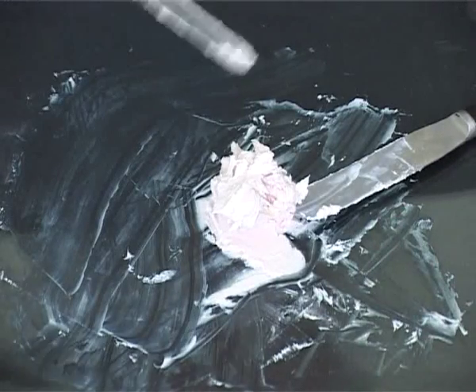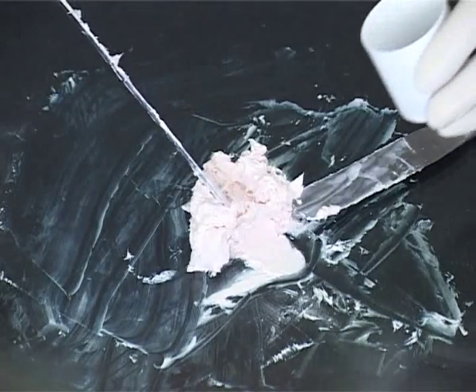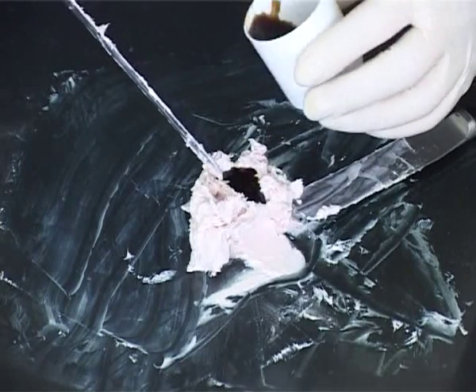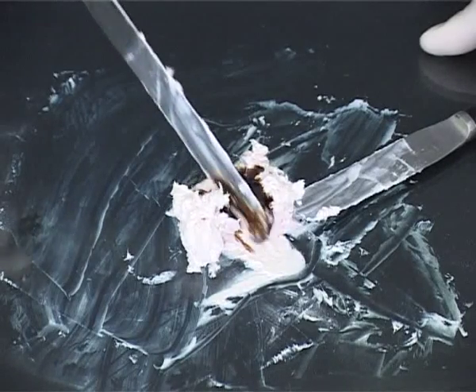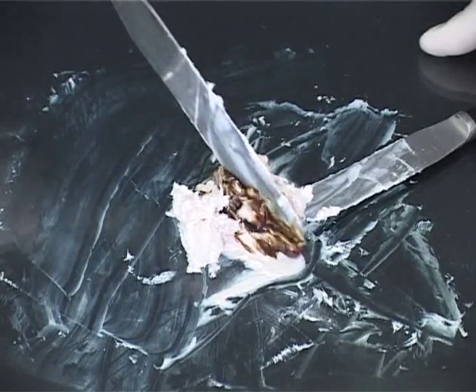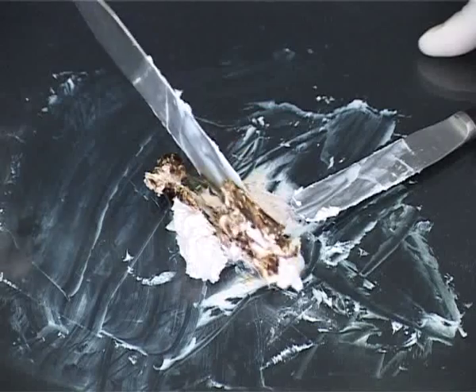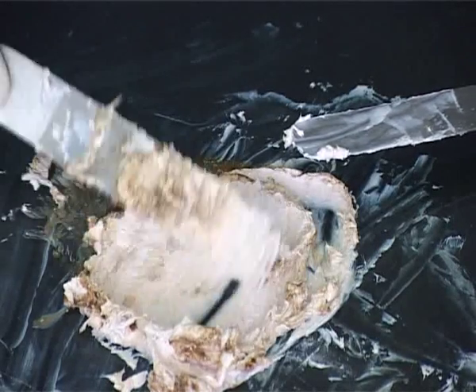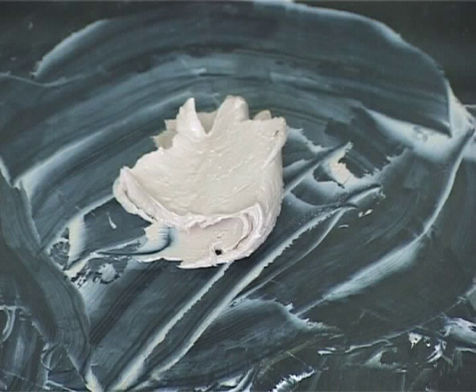When the powders have been incorporated, any liquids are triturated with the ointment on the tile. Make a well in the centre of the ointment mass and pour in a small amount of liquid. Score the ointment with the spatula to help incorporate the liquid. Then gently fold the liquid into the base to avoid splashing. A well mixed product is produced, ready to be packed as for creams.